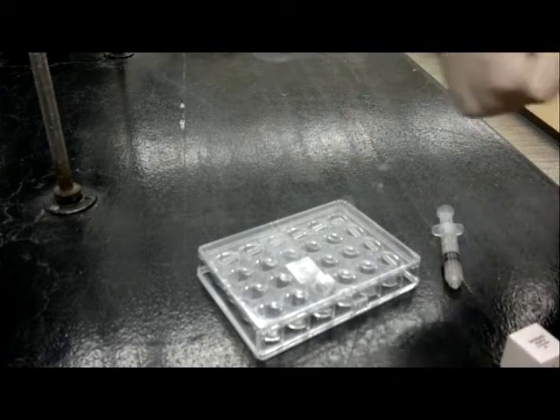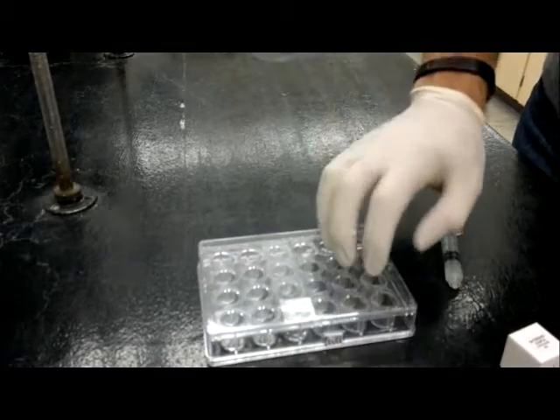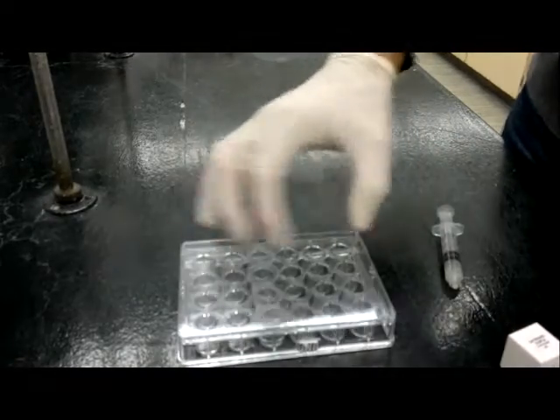This is a little guide to setting up the crystallization experiment for our formal lab. You'll be provided with a plate. A crystallization plate looks like this. It's 24 wells.